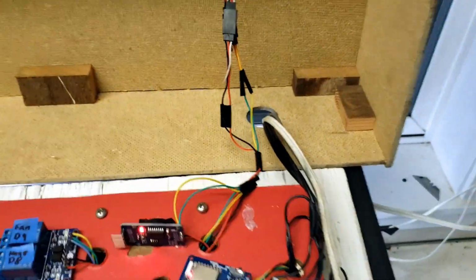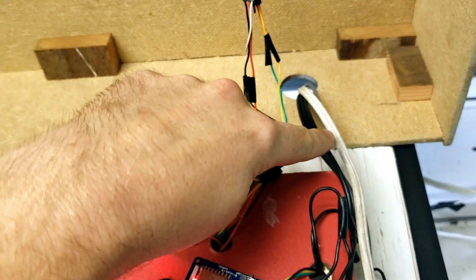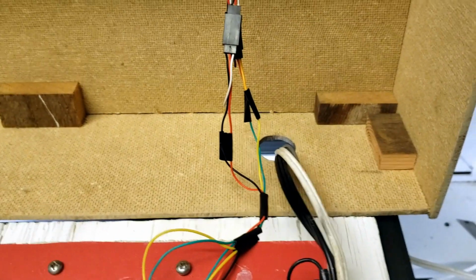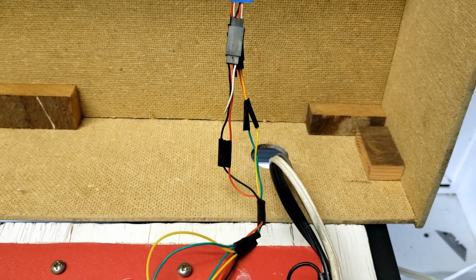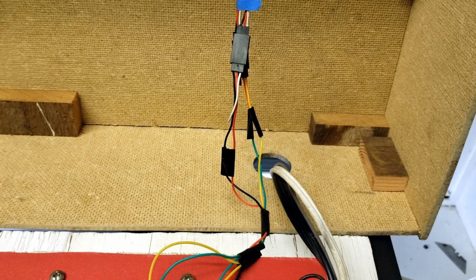And then, see, back here, we have three wires coming out of this box. We have the main power wire, and we have the lights wire, lights power. So that's a whole different circuit, because I wasn't sure how much current those lights would draw. It was just safer to keep it on a separate circuit.